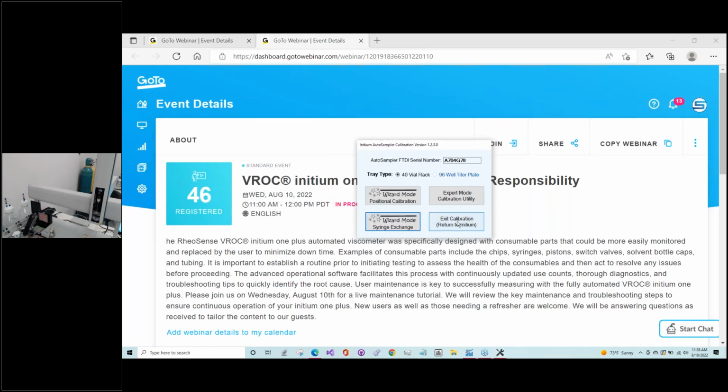And we can exit. And you notice that even though, while that was happening, we pushed on the auto sampler a bit, it's regrouped and it's found its home there.